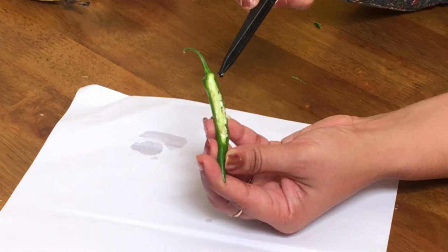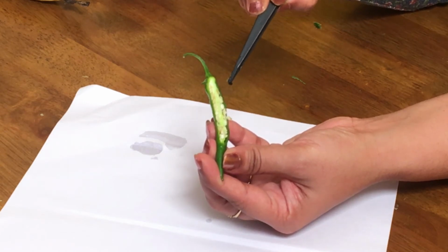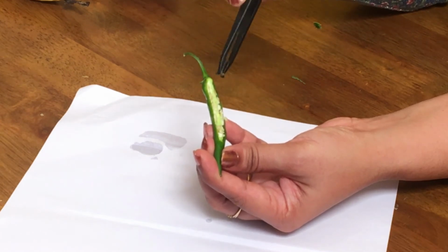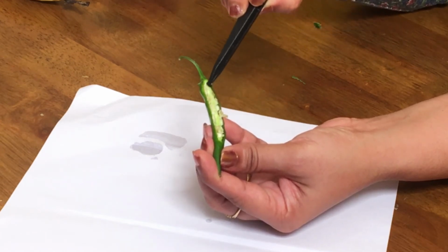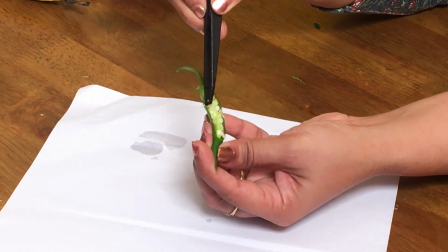inside. In chilies, the epicarp, meso and endocarp are fused together, forming a single pericarp. This is the placental tissue on which you can find multiple seeds. So these are all the seeds of chili.